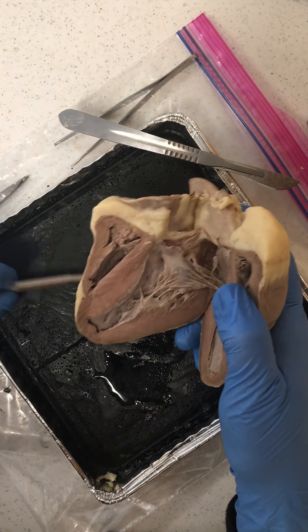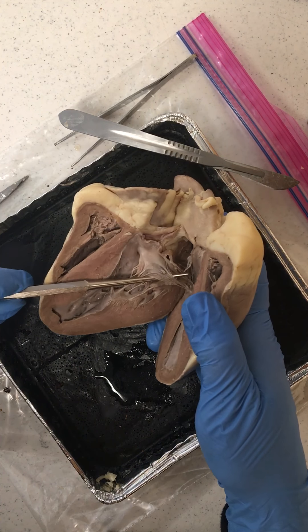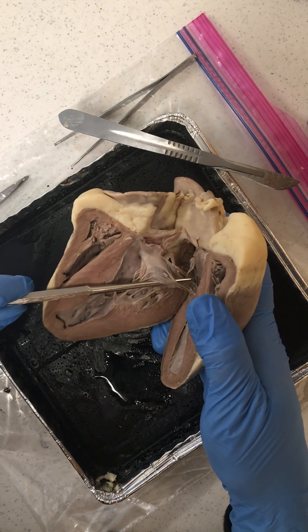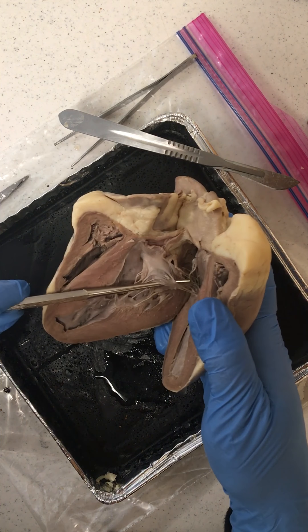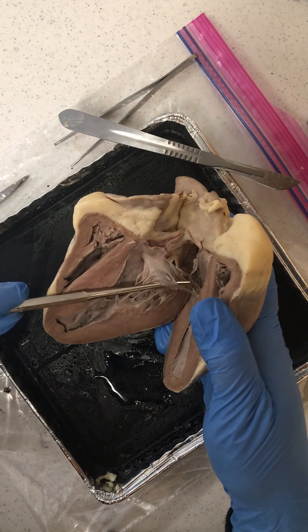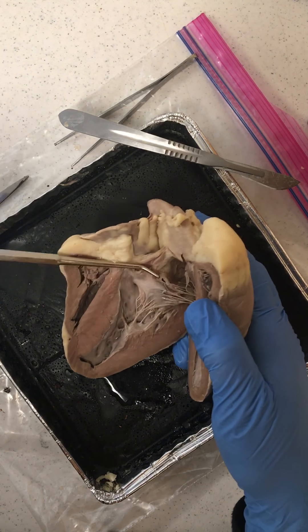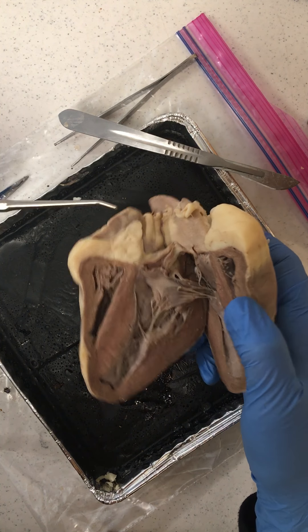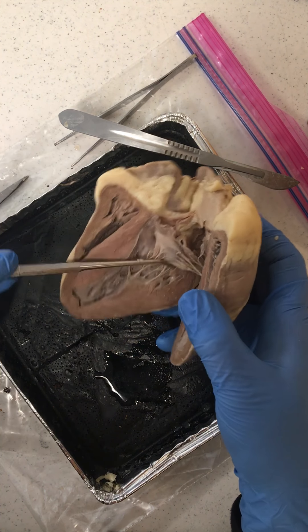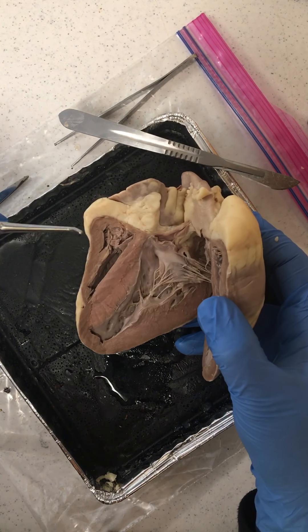Other things to note are those fibrous tendons — the chordae tendineae. These fibrous cords connect the different valves between the atria and the ventricles, and they are connected with the papillary muscles.